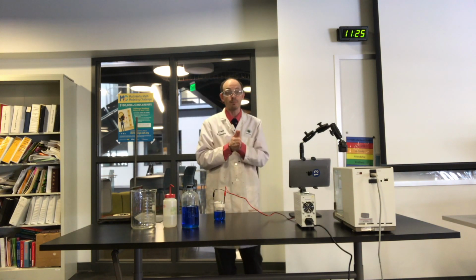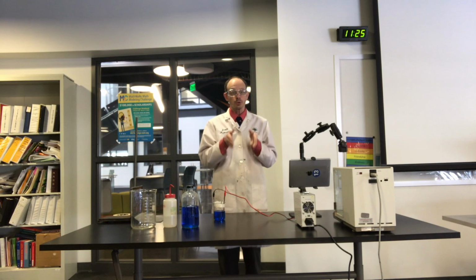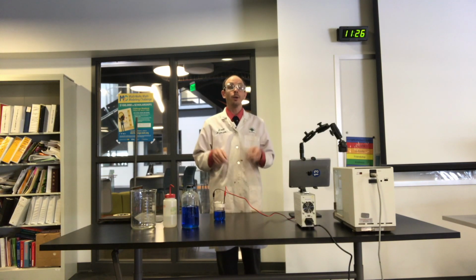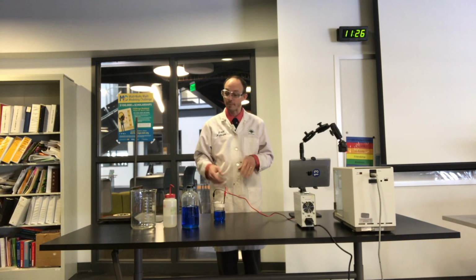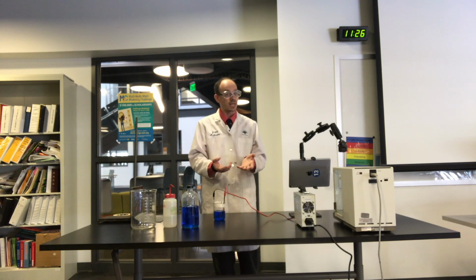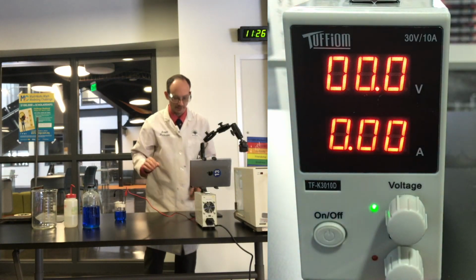So timing is critical. As soon as I turn on the power box, that's when your time begins. So you should know where on this video the time marker is for start and where the time marker is for end. We're going to attempt to be somewhere between 3 to 5 minutes so that we can have a good flow of electrons before we stop it. Then we'll rinse, take our final masses, and be done, because everything else now is calculation in your hands. So here we go. Ready? And on.